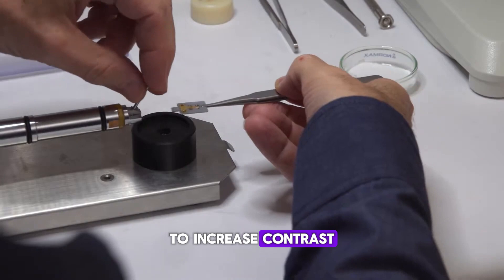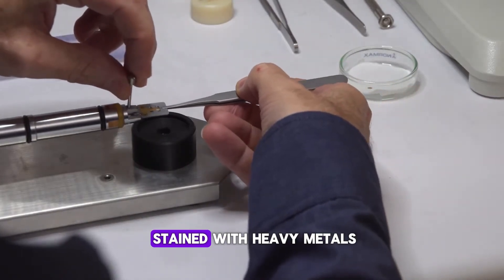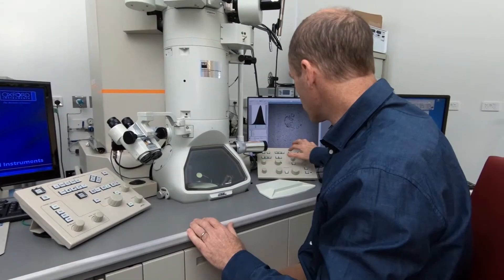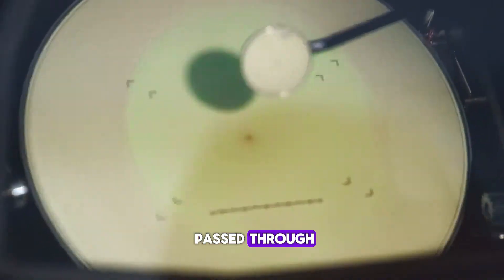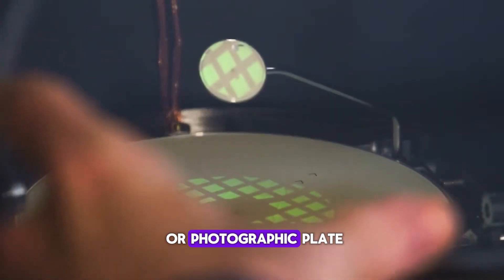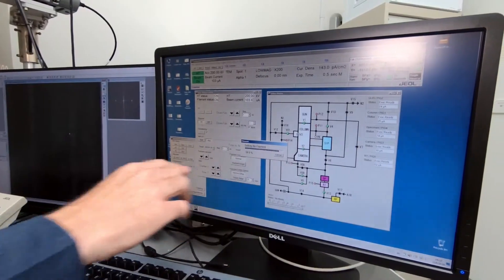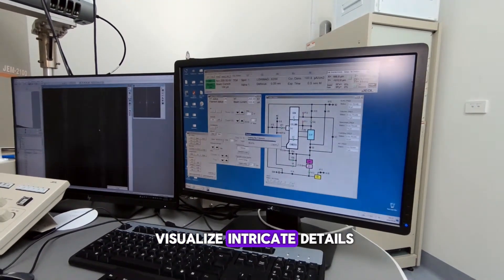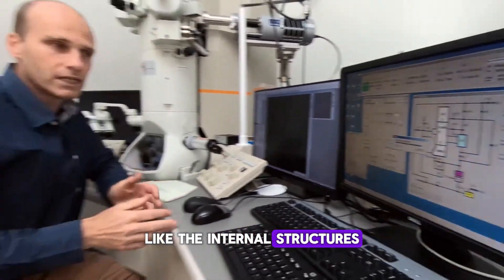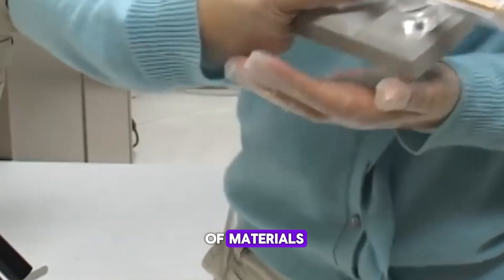To increase contrast, the sample is often stained with heavy metals like lead or uranium. Once the electrons have passed through, they hit a detector or photographic plate where an image is formed. This allows us to visualize intricate details, like the internal structures of cells or the crystal structure of materials.